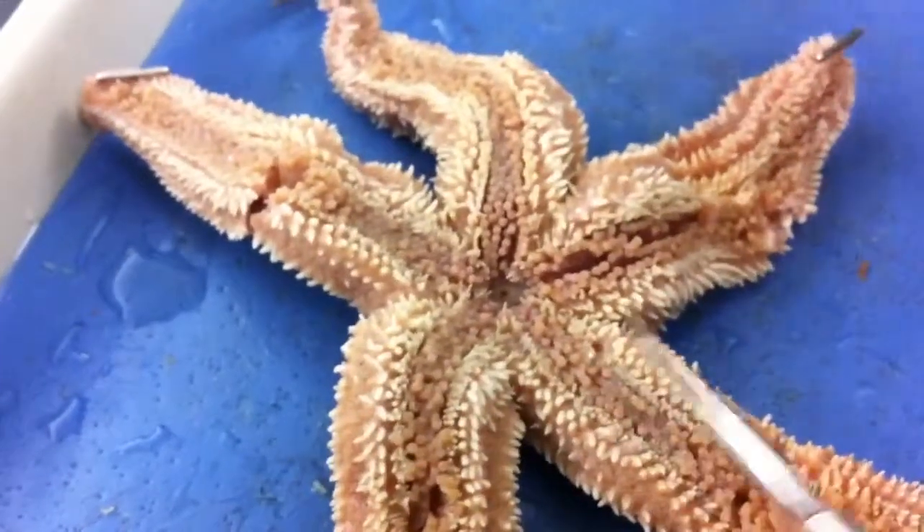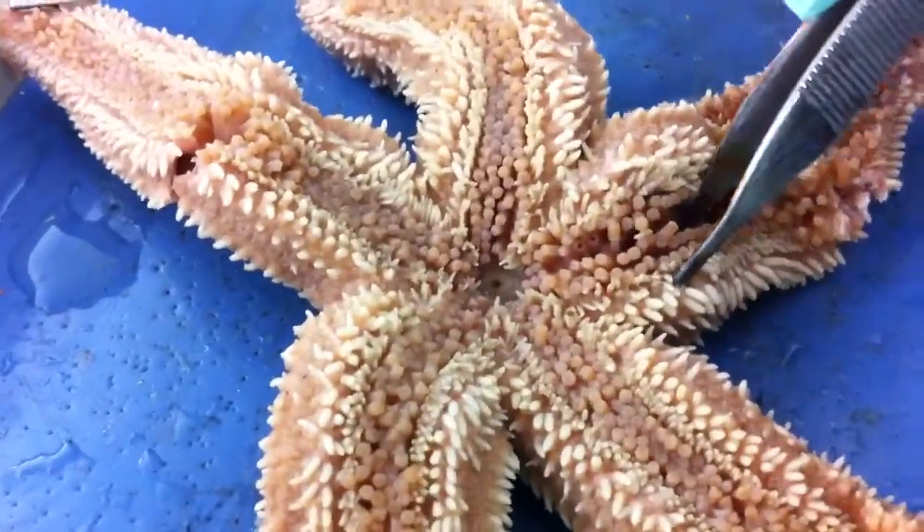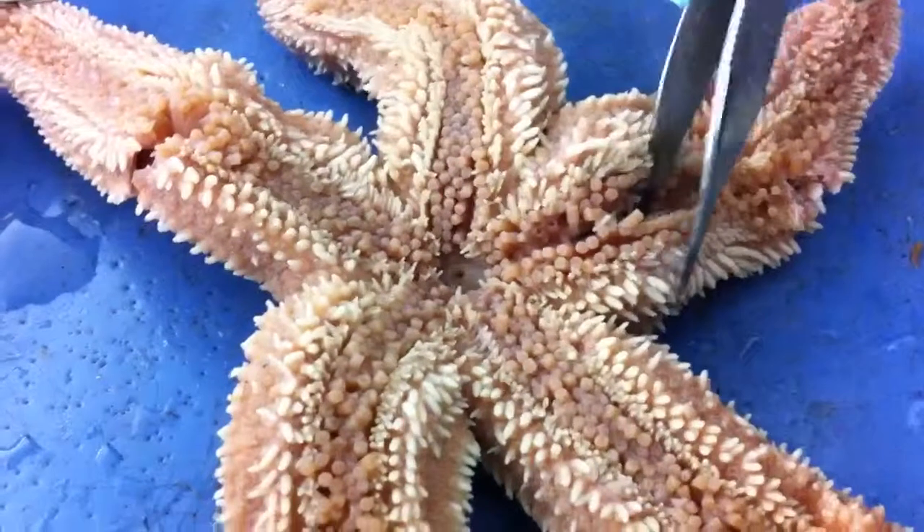So we're pretty rough. I'm not sure what it is, but we'll see. I feel bad. Yeah, you should feel bad. It's like your finger and your arm.